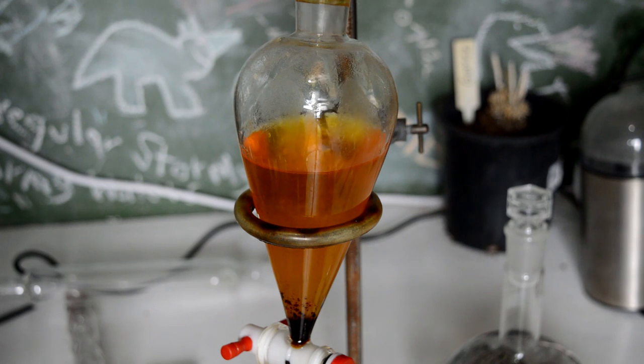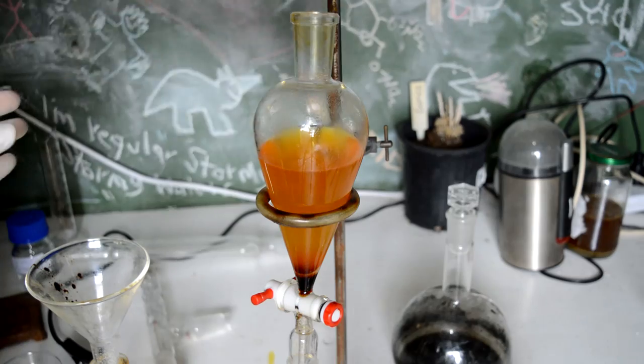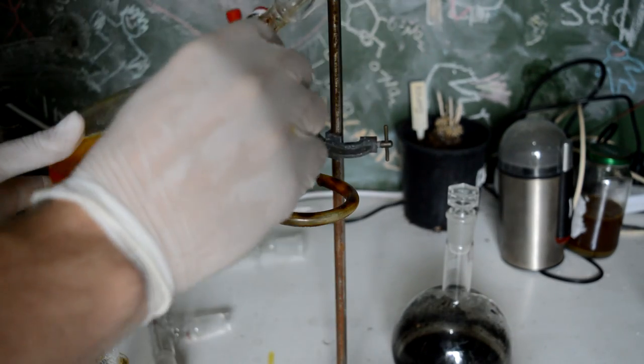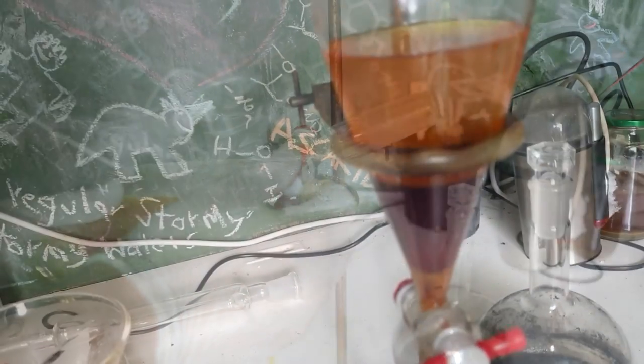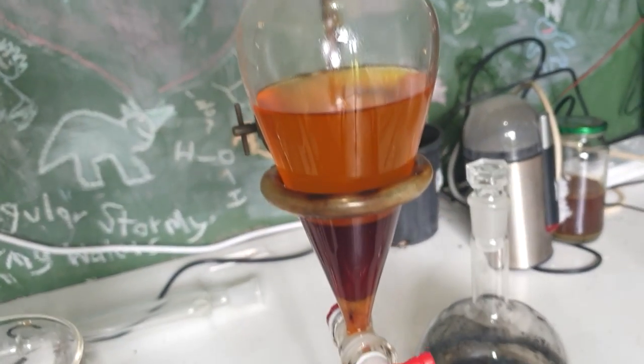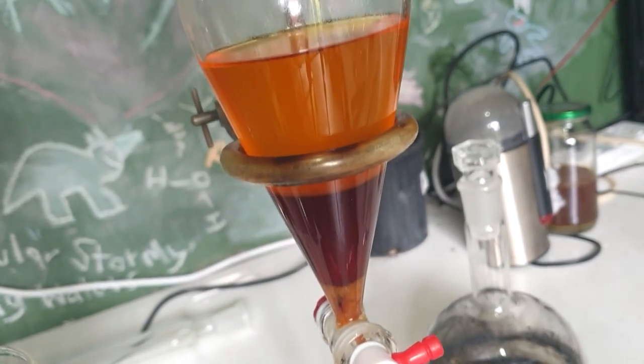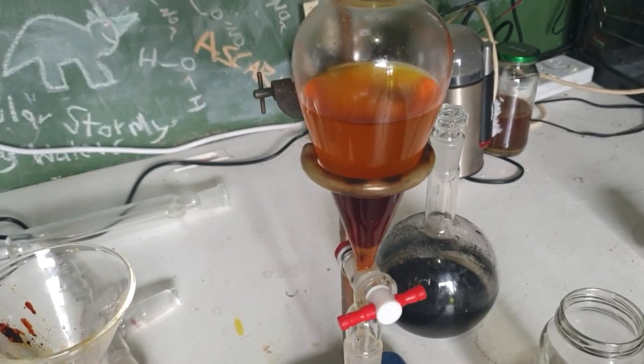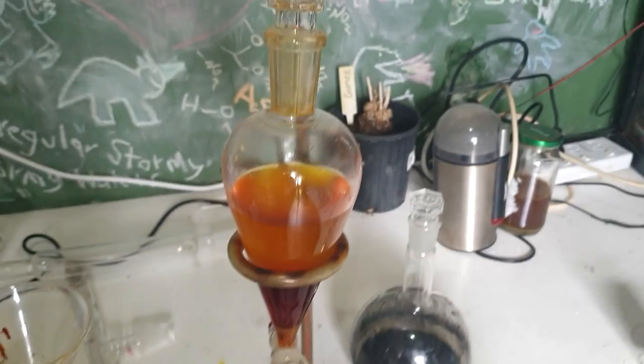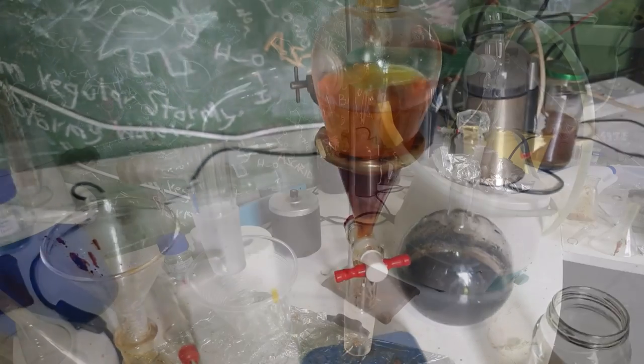For some reason I decided to give it a wash with salt water to try and dry it out. In pretty much immediate hindsight, was a stupid idea because dioxane is quite soluble in water—I think it's miscible in water. We probably lost more dioxane than we dried it out, and the potassium hydroxide did a reasonable job of phase separating and drying it out. The sodium chloride wash has probably reversed that, so I've dumped a whole lot of salt in to try and drag out the water and get them to phase separate better again. That was a bit stupid. I hope we end up with more dioxane than we started with this whole procedure, but I'm worried we're not going to, and that would be embarrassing, wouldn't it?